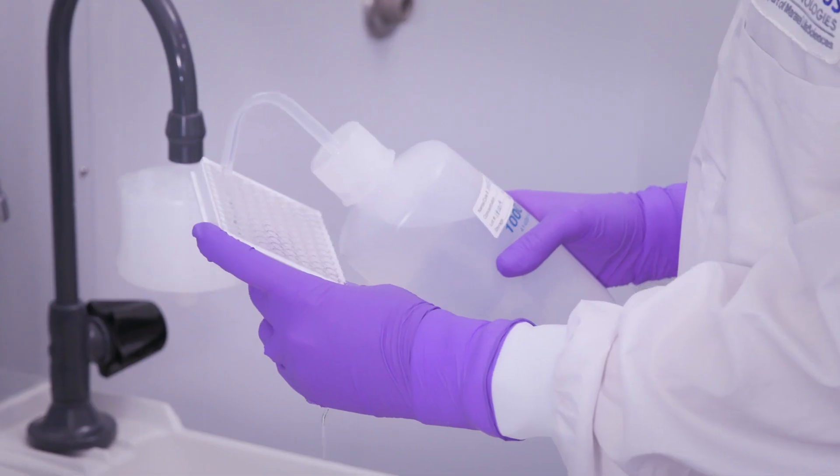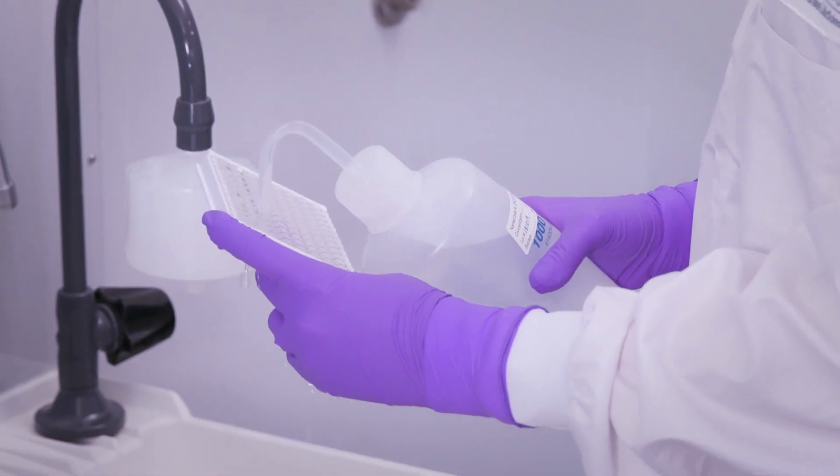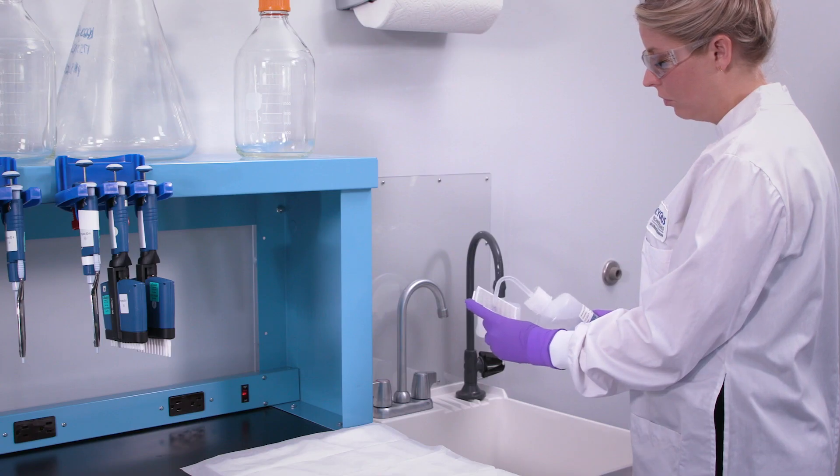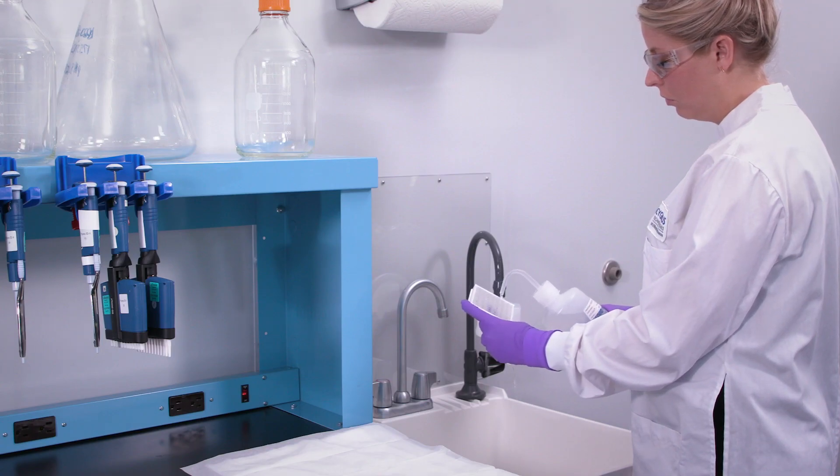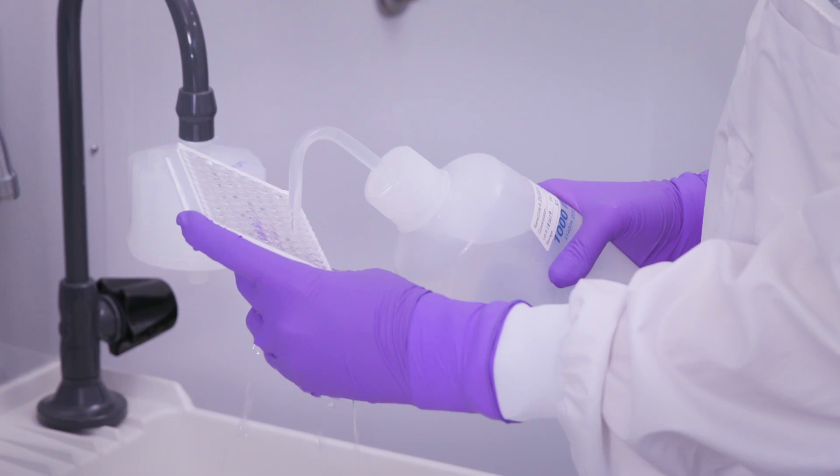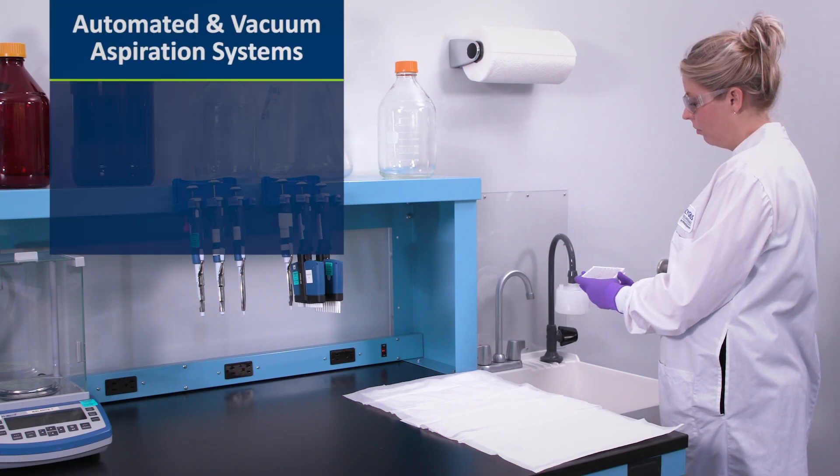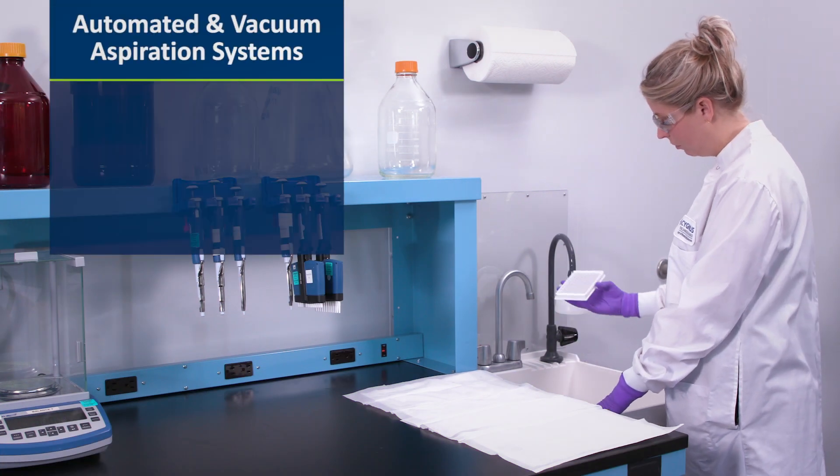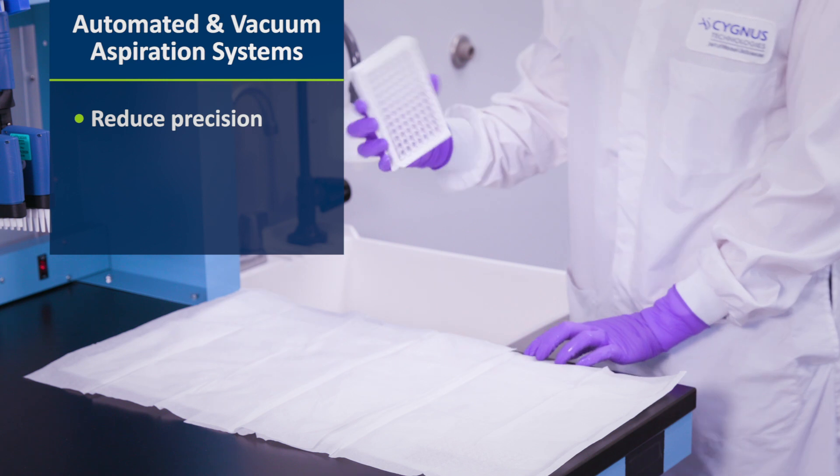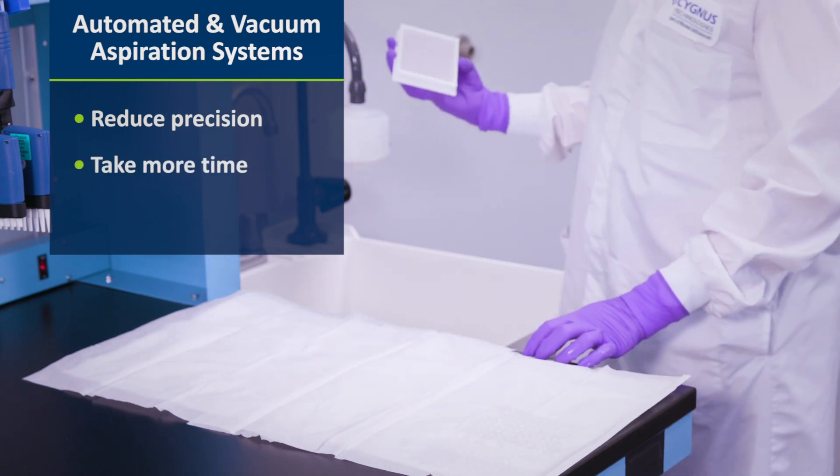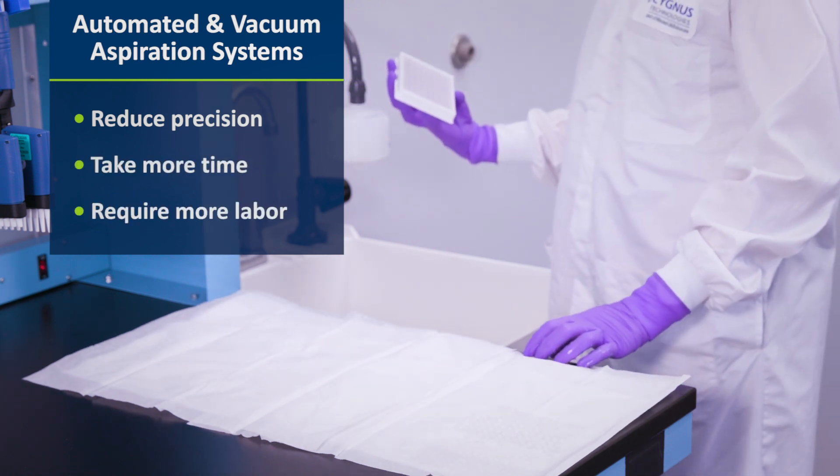The primary goal of washing a plate is to remove unbound reactants. However, many technicians fail to recognize that this process can also dissociate antibody-bound reactants. Our experience has shown us that automated microtiter plate systems and other handheld vacuum aspiration devices significantly worsen the precision of the assay compared to the manual method that will be demonstrated here.